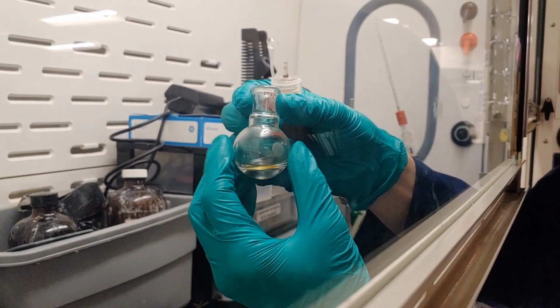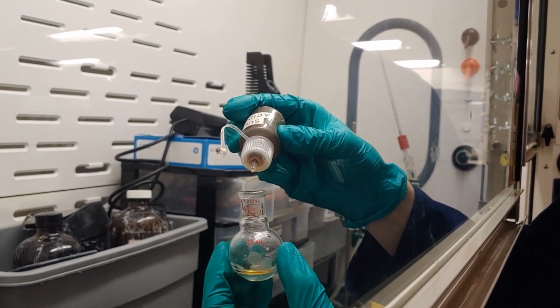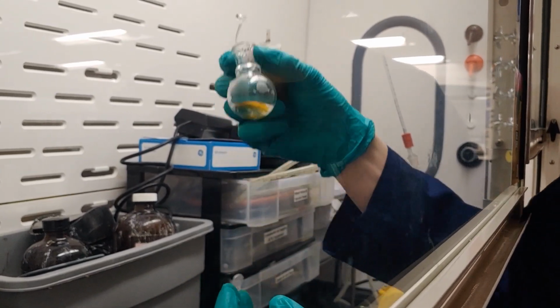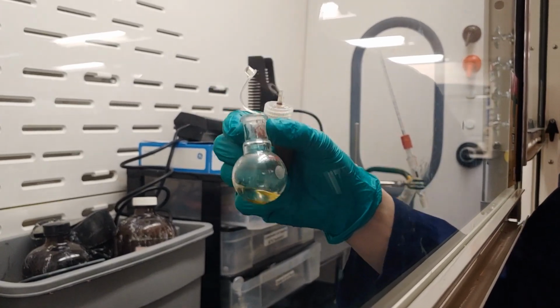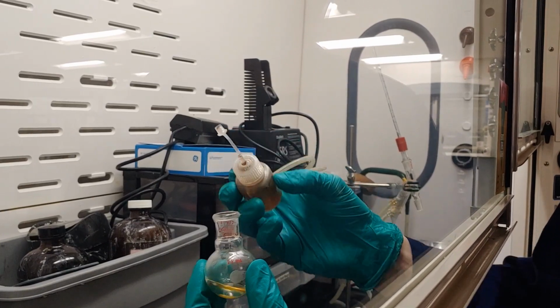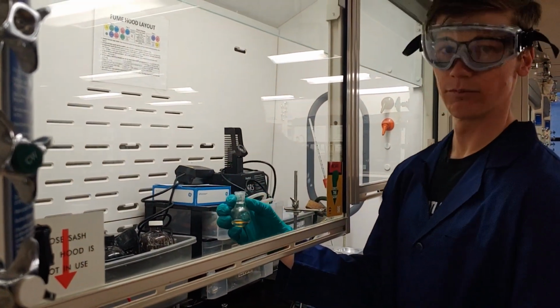At about 13 drops, it's starting to get a little bit of a yellow color. I'll continue swirling and add a little bit more. 14, 15. 21, that yellow color has gotten a little bit larger, started to become a little bit more vibrant, so I'll continue adding to about 25. So at this point, I've added about 25 drops of sulfuric acid. I'm ready to reattach it to my distillation setup and get it distilling.